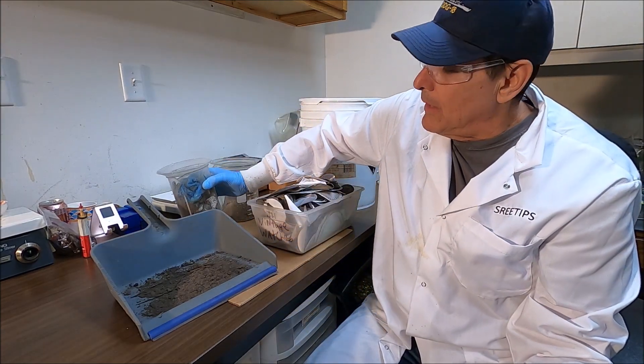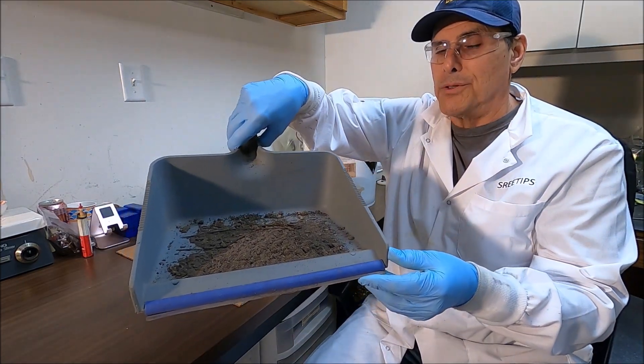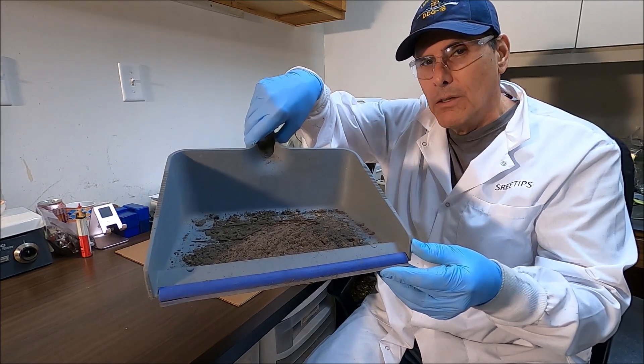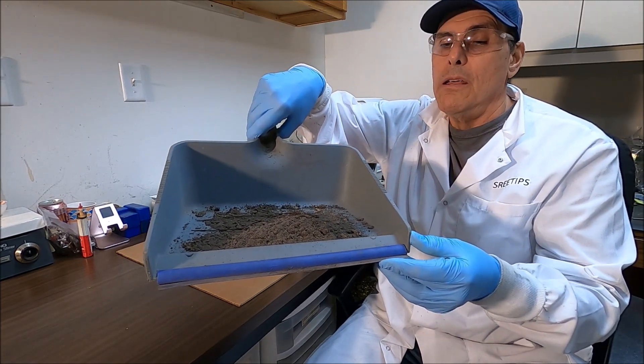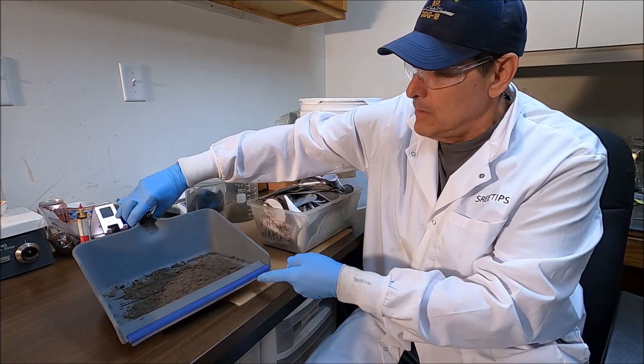And we'll be burning all that today. Here I've got a dustpan with some material that I scraped off the back of the baffle from my fume hood and we'll be burning this and processing it also.